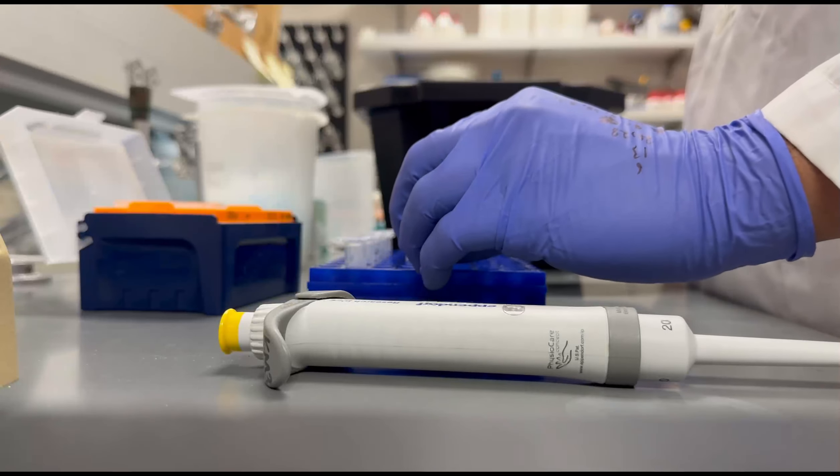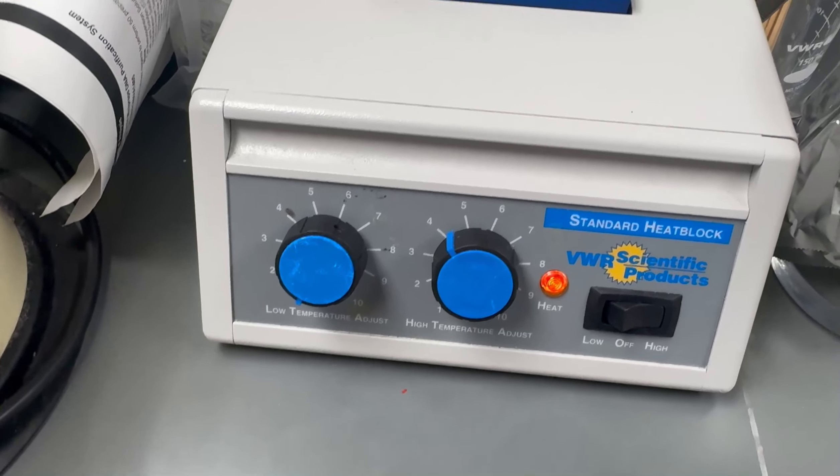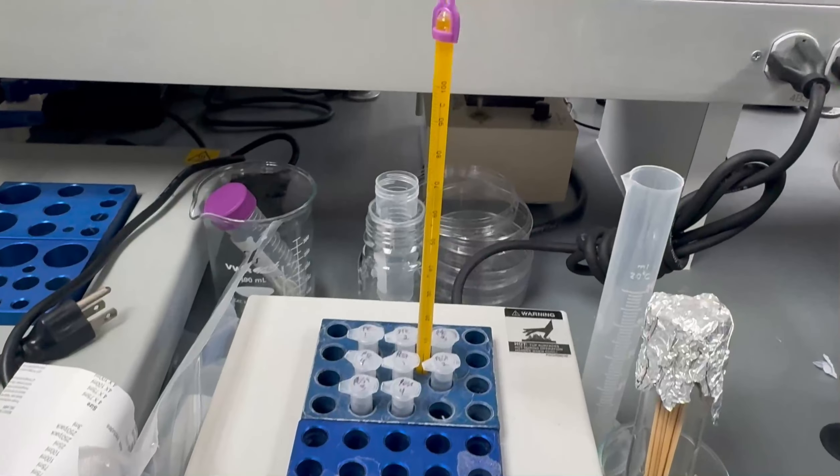After mixing the components, the samples are heated at 95 degrees Celsius for approximately 5 minutes on a heating block.